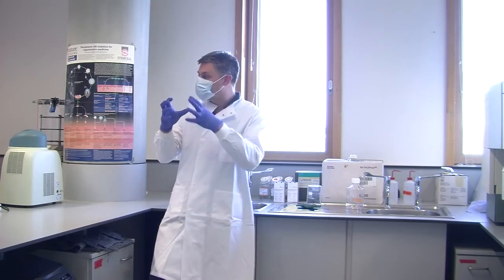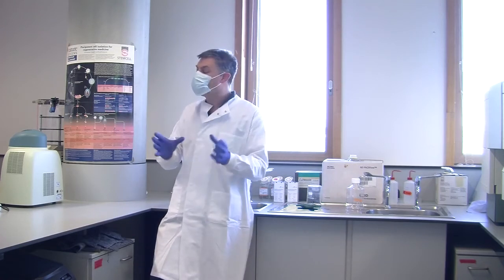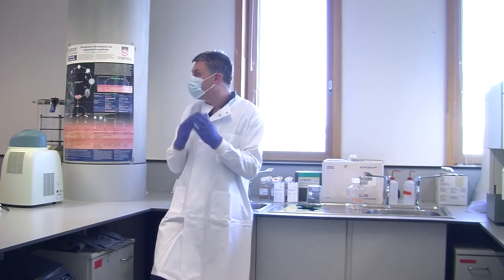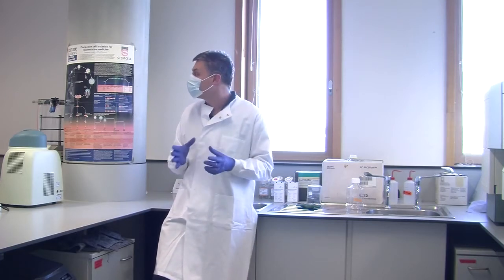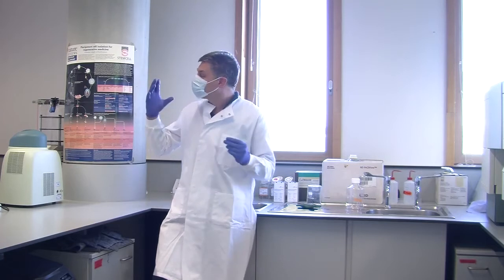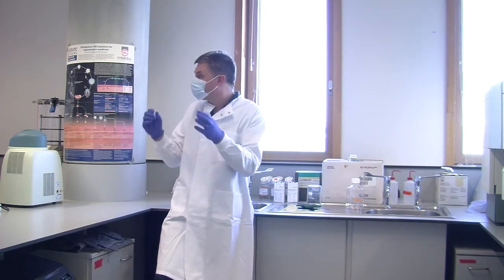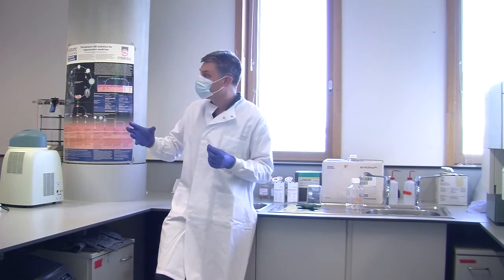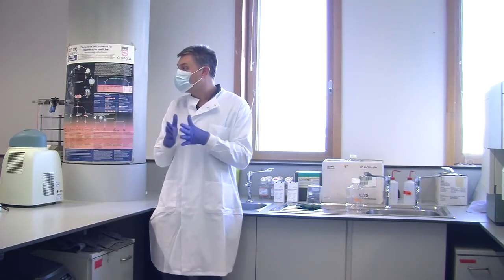What we've done is we've taken that GFP, made it in the lab, and stuck it to an antibody. So the antibody recognises a particular sequence on a protein. If it sees that sequence, it sticks very, very tightly to it. If I remember rightly, the antibody-antigen bond is one of the strongest bonds known in biology. So it sticks really tightly. Now, of course, if it sticks tightly and on the other end of it is a fluorescent protein, anything that has that sequence on, that marker on, will stick antibody to it. Anything that has antibody stuck to it will have fluorescence. Okay? And obviously, whereas GFP is green, we now have lots of different fluorochromes.